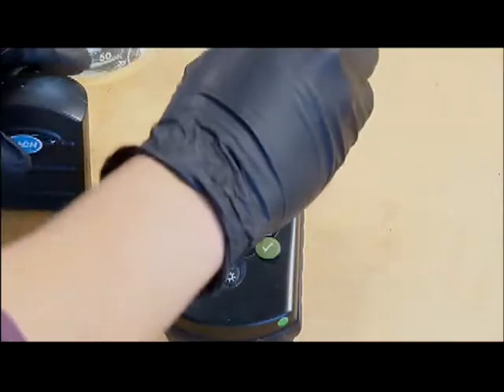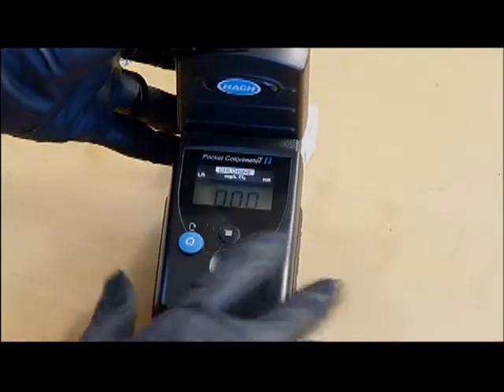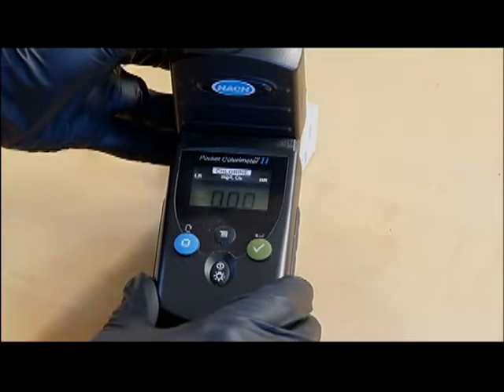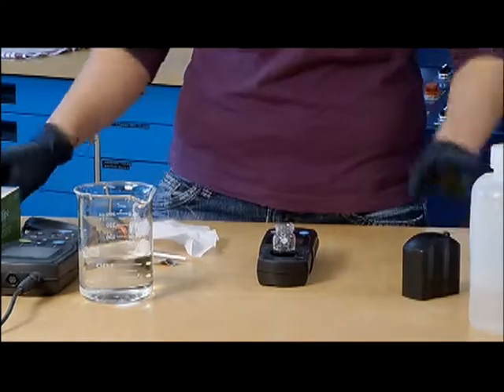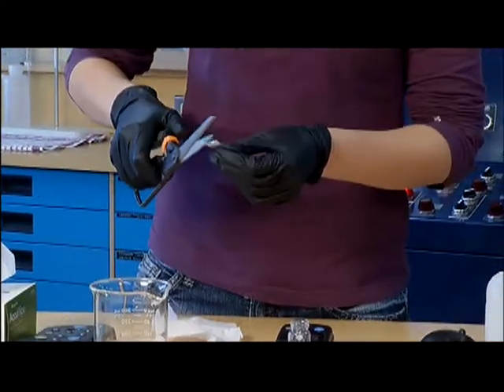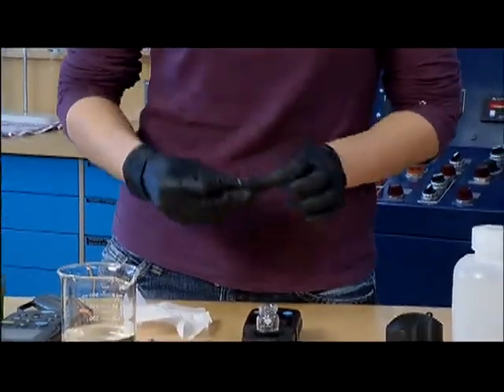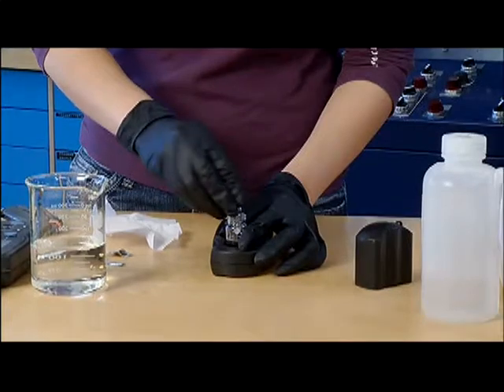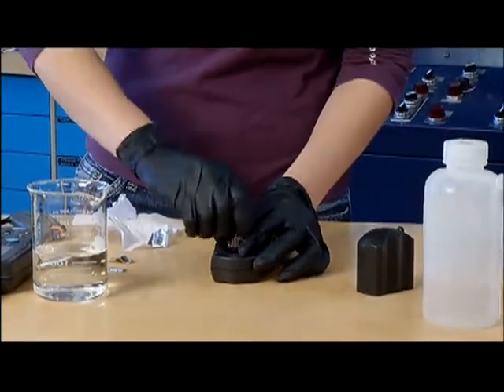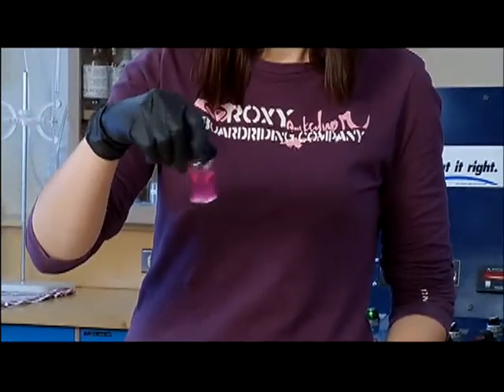Put the uncolored sample into the colorimeter and zero the sample. Cut the pillow pack, always ensuring the cutting tool is free from contamination. Put the pillow pack of reagent into the sample vial and place the lid on the vial.